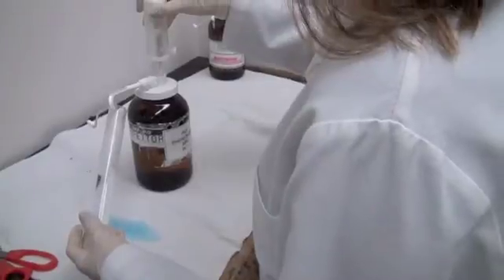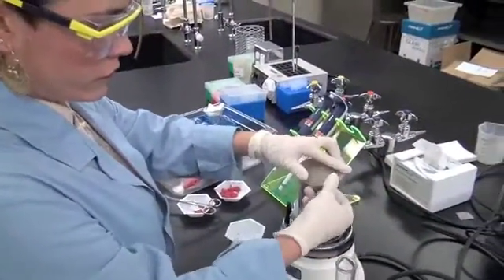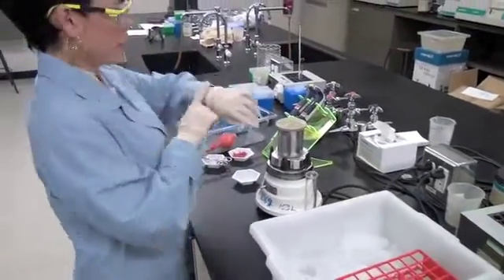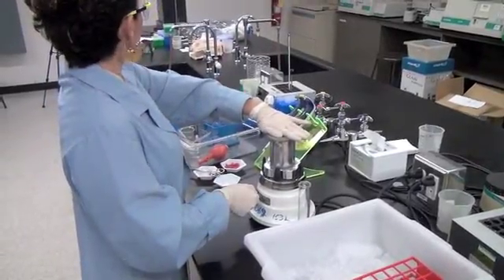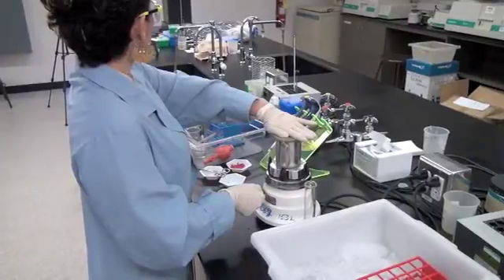Ostensibly, her errors will result in a lower starting amount of enzyme relative to Biochemist Dicer's. And quite possibly, she will have a lower specific activity since enzyme activity will be more affected than the unknown's ability to bind to the protein. Now Biochemist Dicer has placed her meat and cold phosphate buffer in the blender cup. She has secured the lid on top so as not to lose any sample and is blending away.